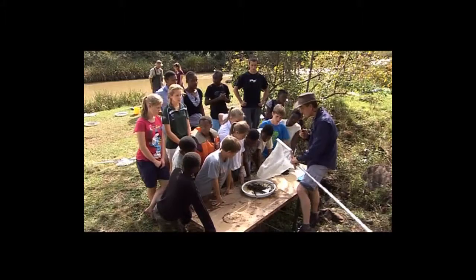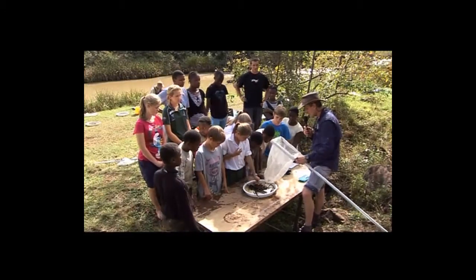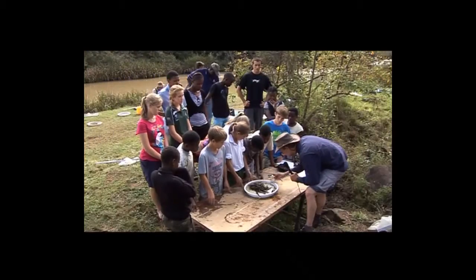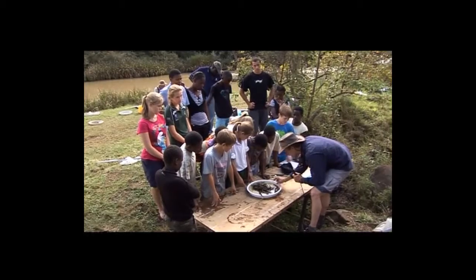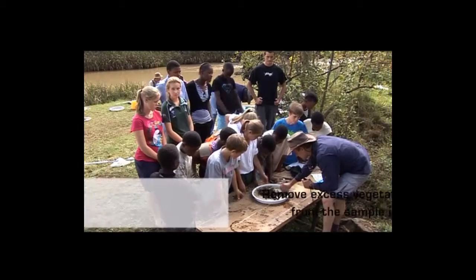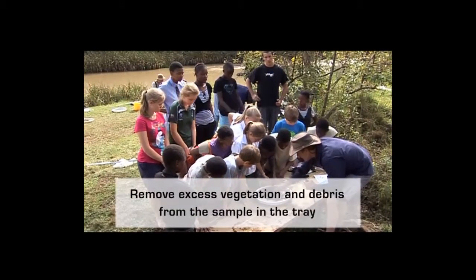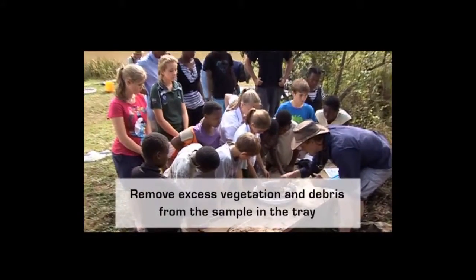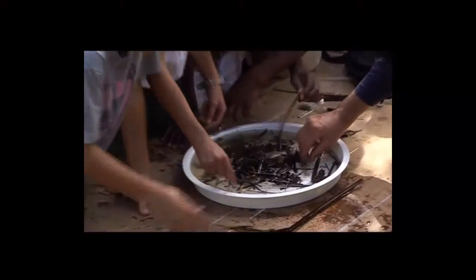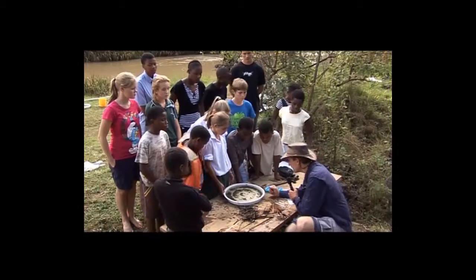Okay, alright, so we've got everything we need from our sample, from the river, in our net, and now into a nice clean white tray. And this is our vegetation sample. Okay, and the trick now is to just clean up the sample a bit, help remove some of the excess vegetation, put that to one side, just clean it up, give it a shake in the water. Alright, well, let's have a look in here and see what sort of things we're finding.